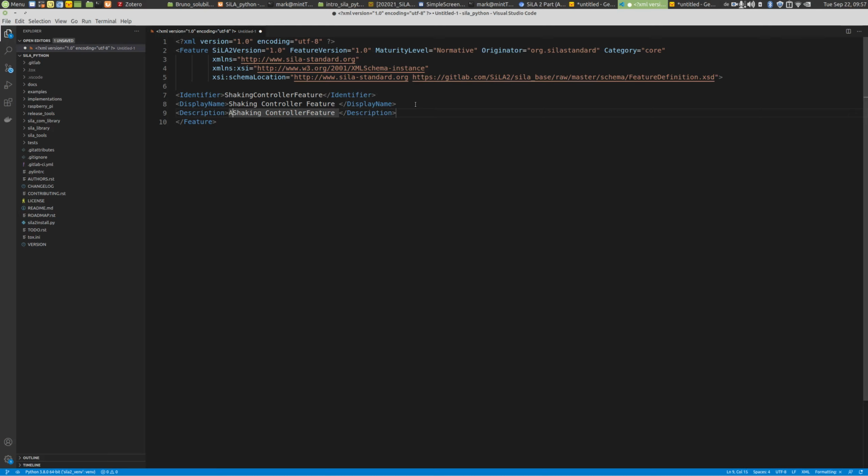And here it's very important that you are very precise about the behavior of your feature, the states of your feature. So you should really explain what your feature does and be very clear about what you want to achieve. Let's just say a feature for controlling a shaking device.